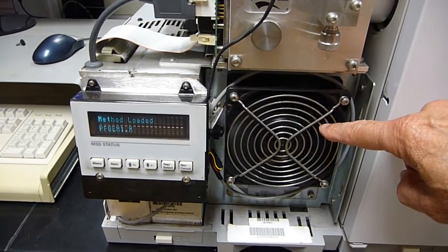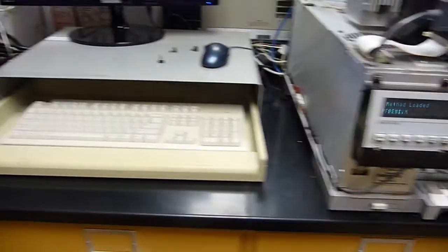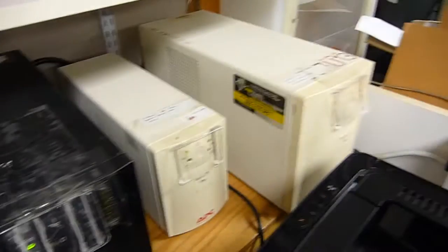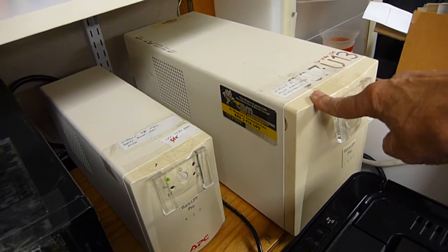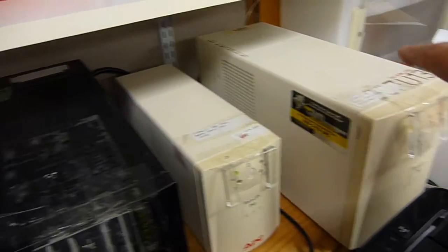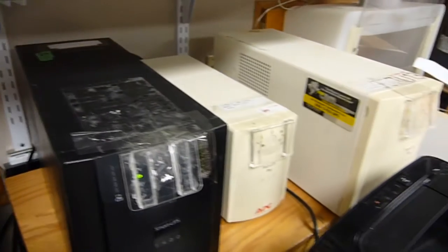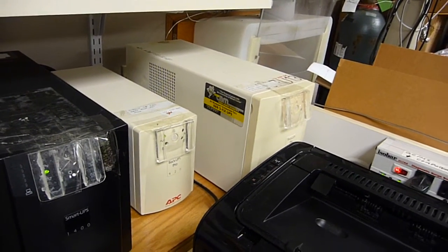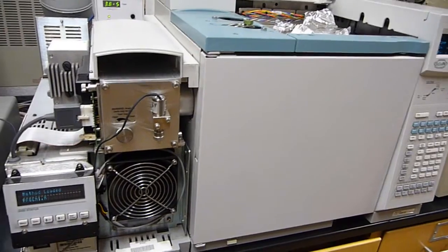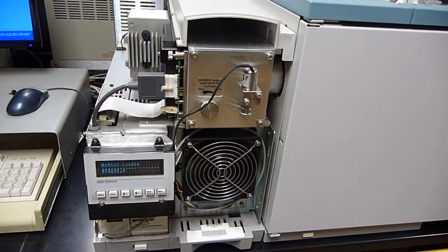Separate UPS for the cooling fan. All right. To keep a fan going, you don't need 1400 watts, so we only have a 420 watt UPS for that. Third UPS is for the MSD electronics. It's nice stable voltage, cut out the spikes. Fourth UPS is for the computer. Right. You're not going to have a cheap UPS big enough for the GC. The idea is for it to survive a power outage without backstreaming.